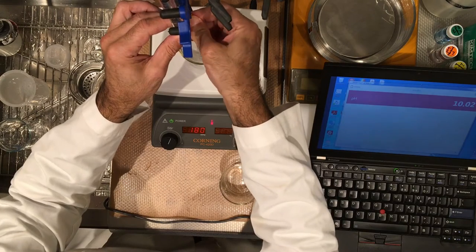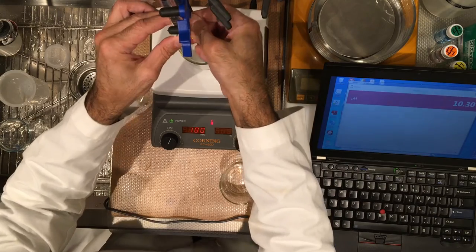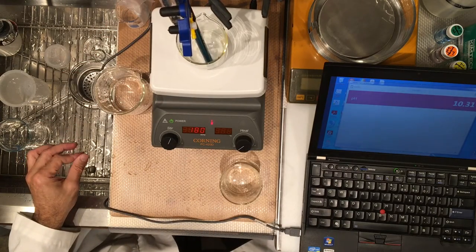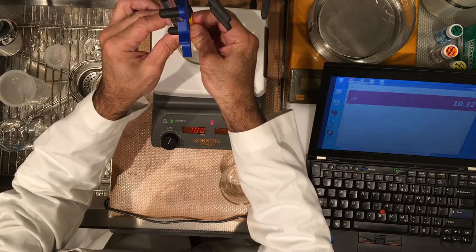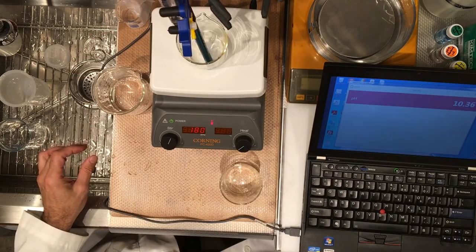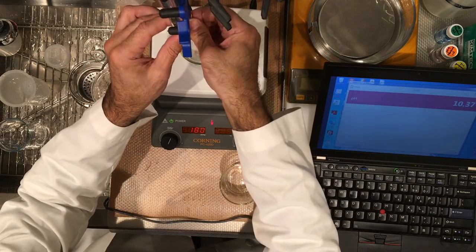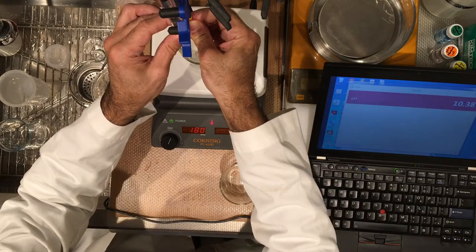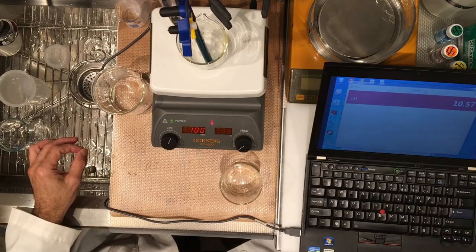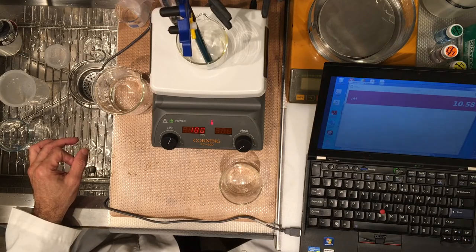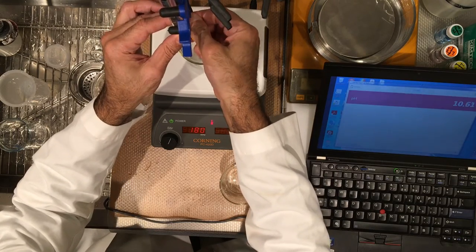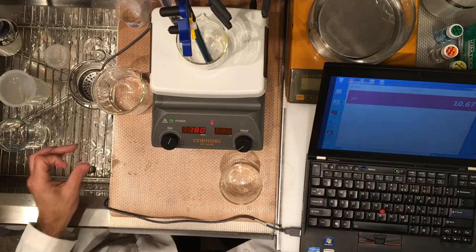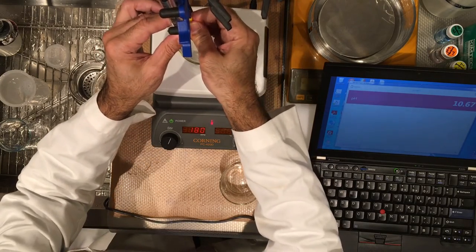Record. Actually went a little too far 11.60. Record. 11.70. Record. Now let's go to 11.90. You're passing the equivalence point record and let's go to 12.1 this is 12.1. Record now we're going to go to 12.5.